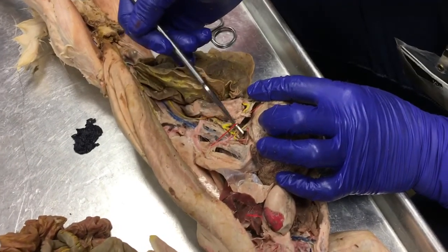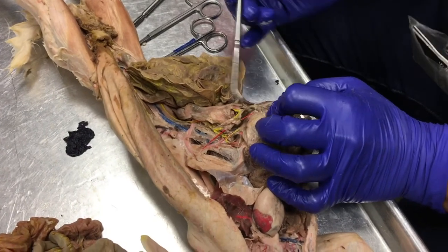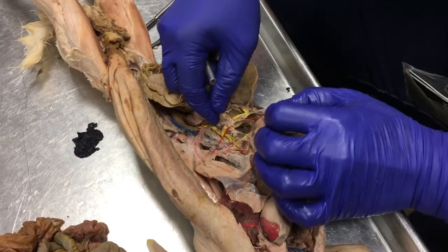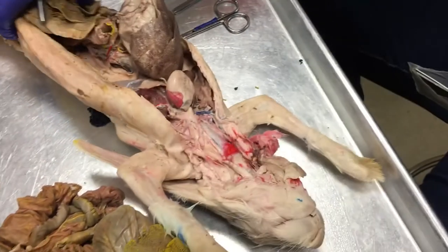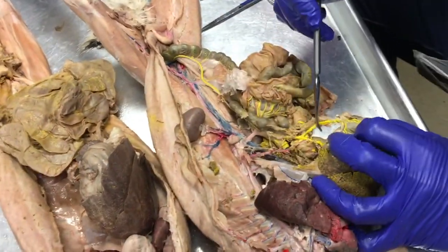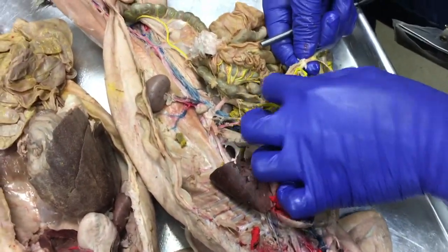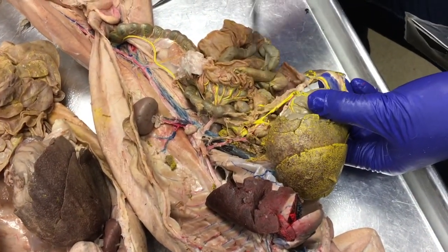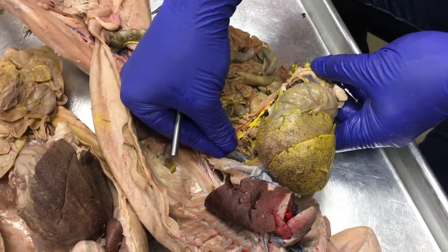This is the gastrosplenic artery. And when it makes its way toward the stomach, you can see that it splits. It travels way up here, so here's my gastrosplenic artery. Oh, that's where it's messed up. Okay, there's the gastrosplenic artery.